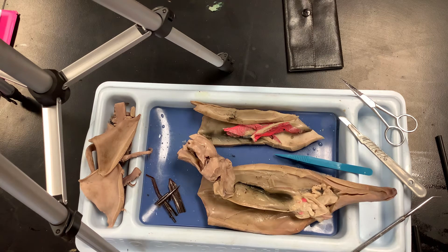The beak is black and it's a two-part structure — you need two parts so that it can crush food. I took my scalpel and cut straight down and pried it open. It'll be one big muscular piece with the esophagus coming out of it. Yes, it's a two-part beak because you have to be able to crush snails and other things.